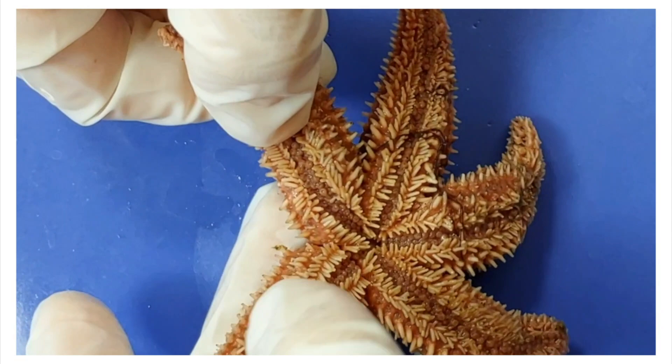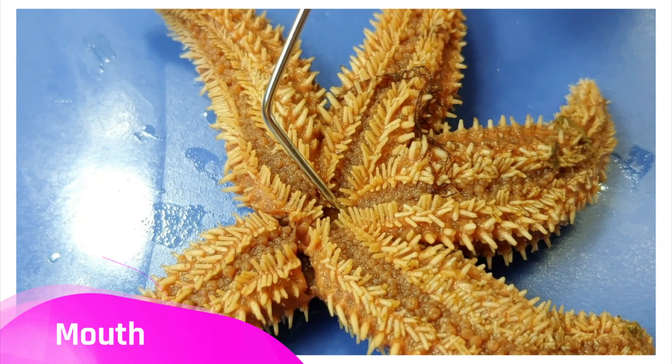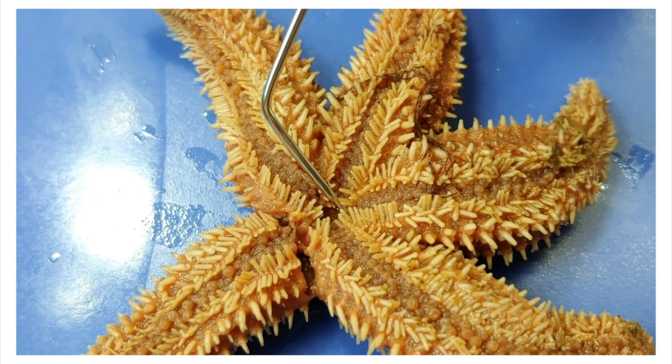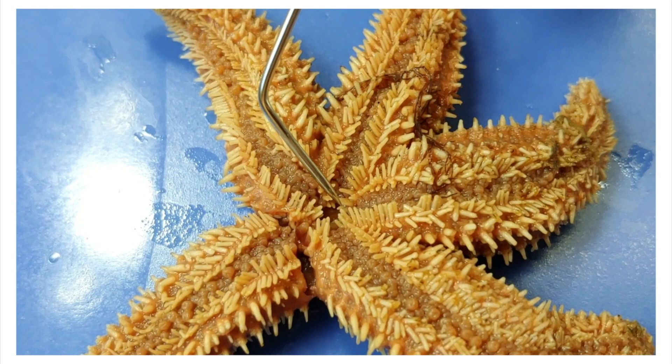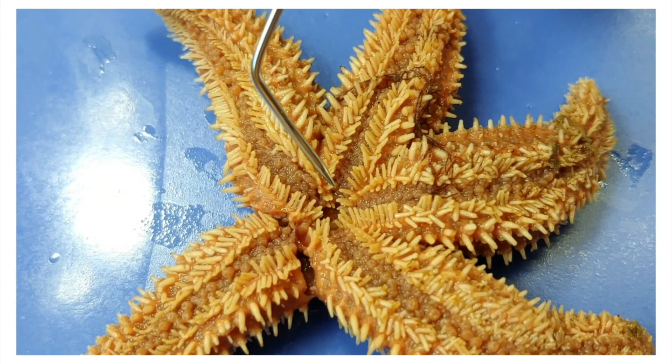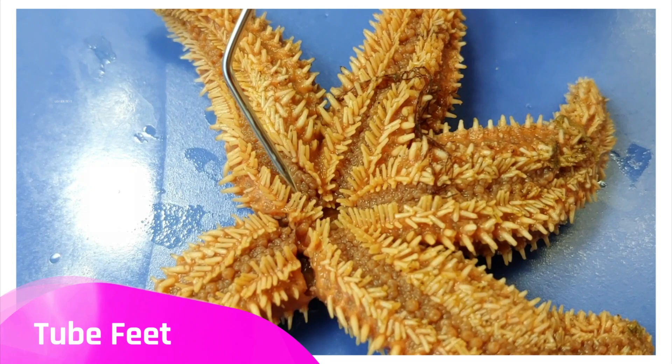Now I'm going to flip the sea star over. Here in the center we have its mouth. You may notice that the mouth is very small — certainly smaller than many of the clams that sea stars like to eat. The sea star has a very creative way around that: it throws up its stomach inside out to engulf its food, and then sucks it back in when it's finished. Nature is wild and sometimes a bit graphic, but I'm not judging. These grooves running down each arm are called ambulacral grooves. You can also see these tube feet — sea stars have hundreds of these and they can use them to move around.